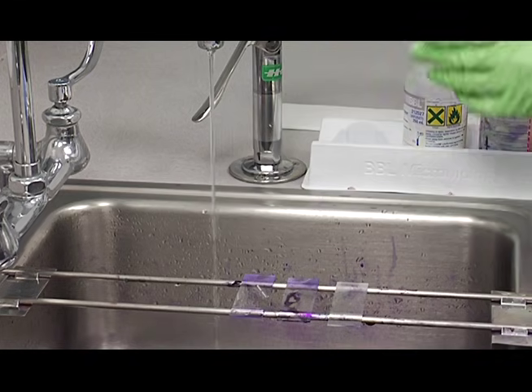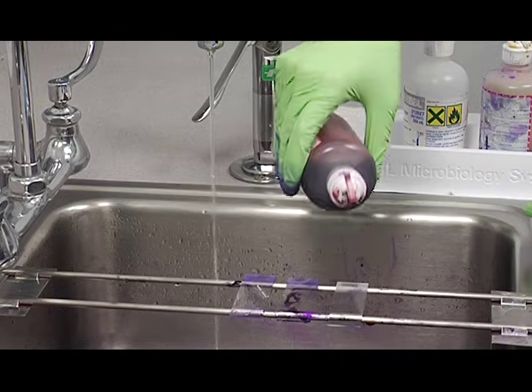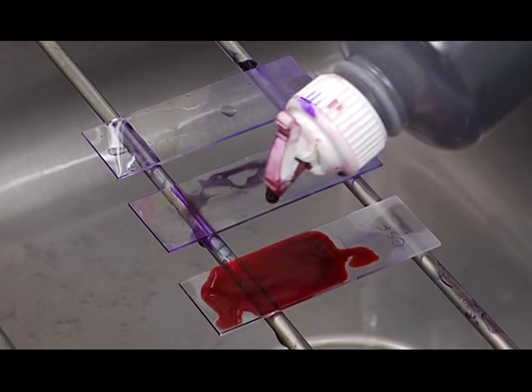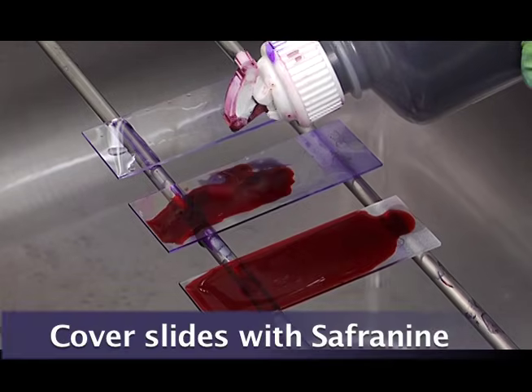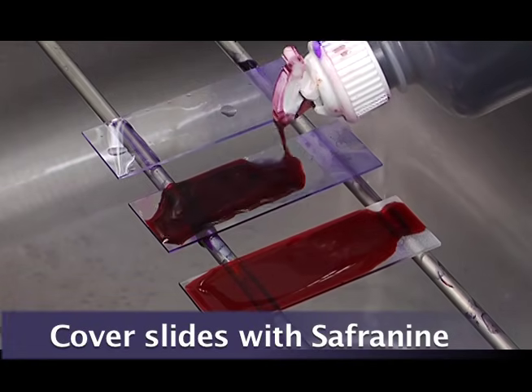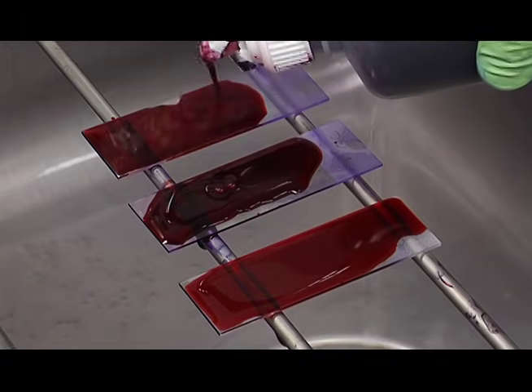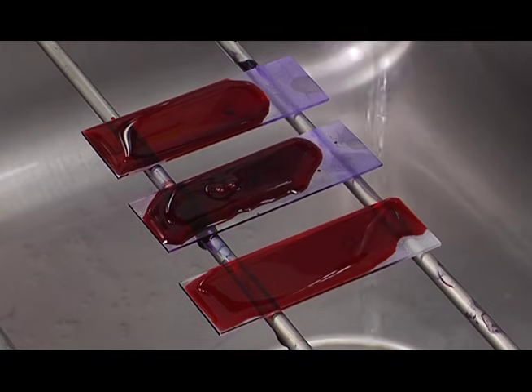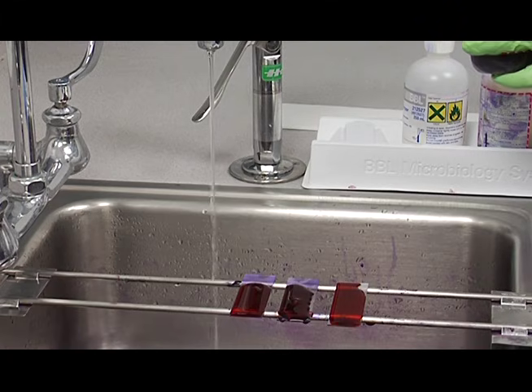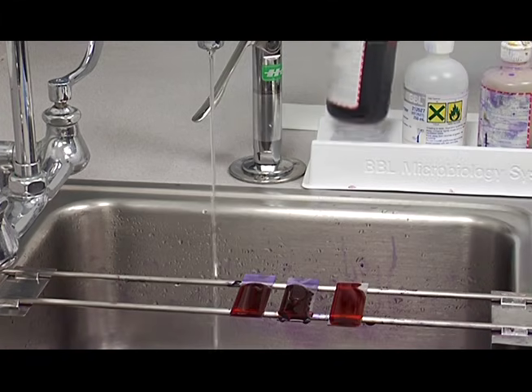Now I'll cover each slide with the safranin, the counterstain. And that will sit on for 30 seconds. It's really important that you shake off the last water before this step so it doesn't get diluted.